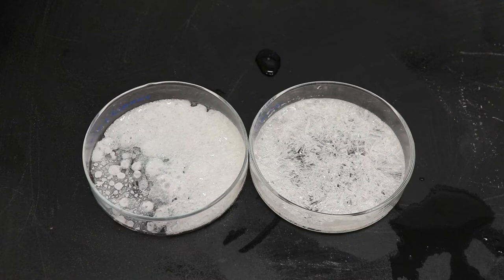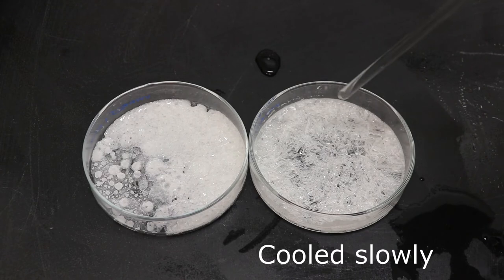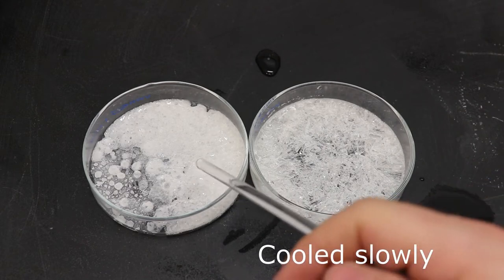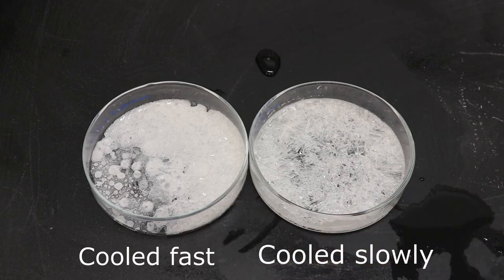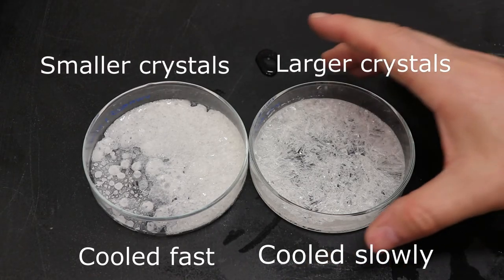All right, so here's the two side by side. This is the one that cooled more slowly, just in open air, without using the ice bath. This is the one that cooled in the ice bath. Now what do you notice? One are much, much smaller.